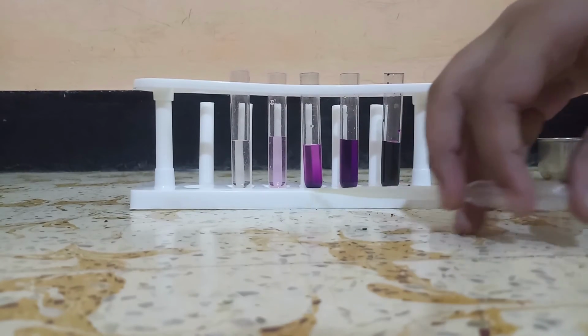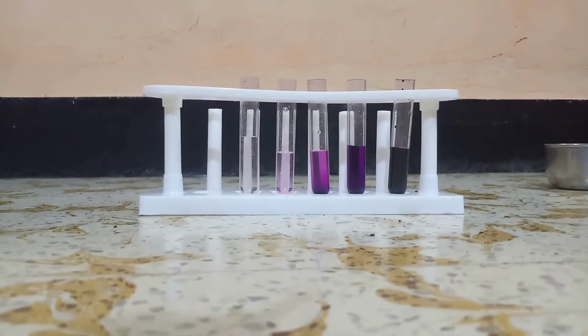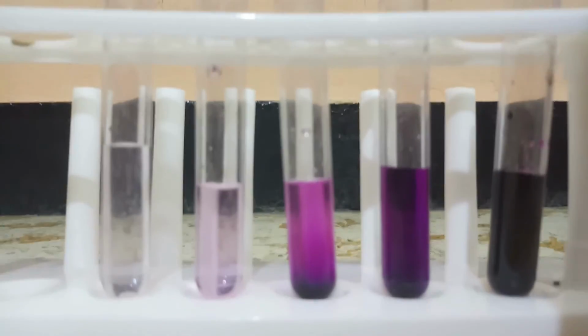You can see the light color. If we take from here to here, we will have only 0.01% of the color. So this is the next step. We are going to take this color and add it. As you can see, it is not much of a difference. So now this is the experiment. Here the particles are very small so that we cannot see them, and they got dissolved in the water.